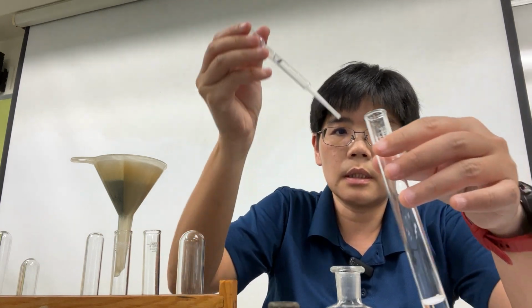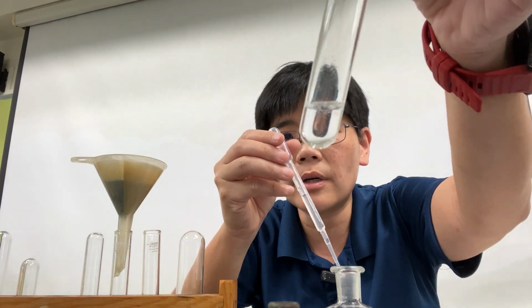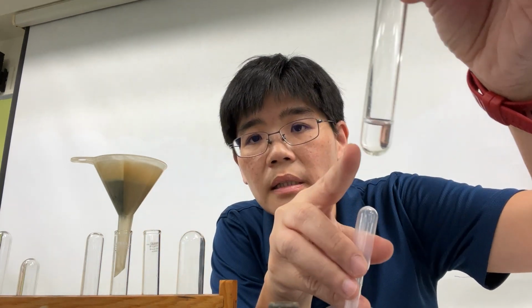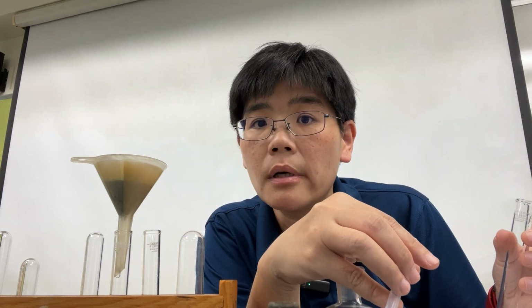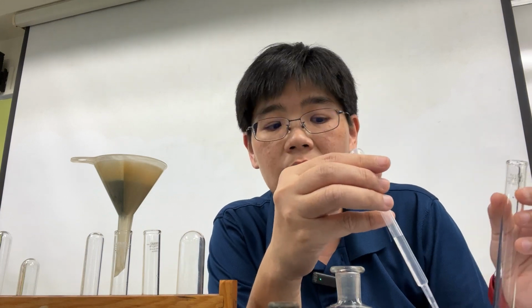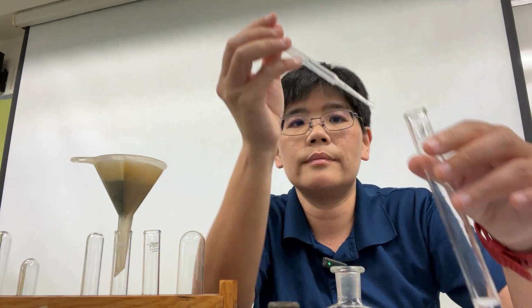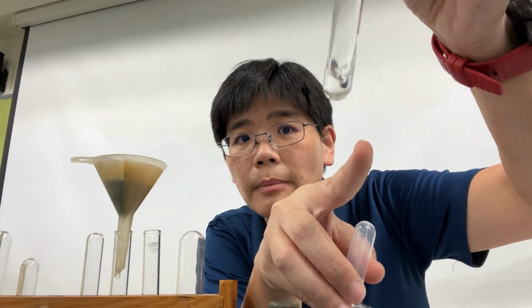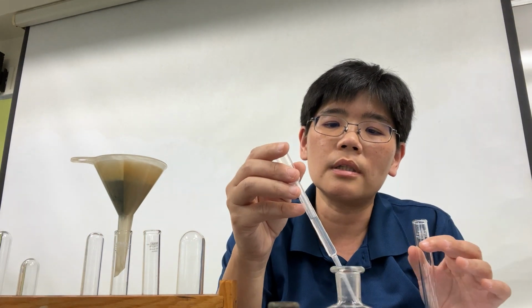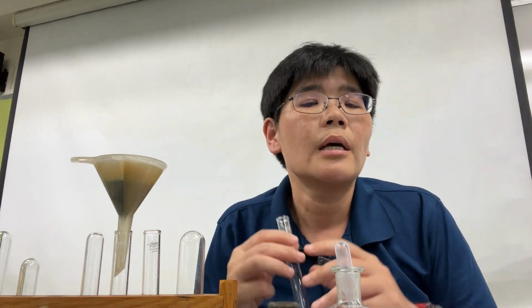So 1 centimeter. Oh. As soon as I add some of the sulfuric acid, I notice that there are bubbles or effervescence, and that I need to write down. So my observation is bubbles seen, or effervescence seen. I have not yet added fully the 1 centimeter, and the bubbles are already gone. So I will add a bit more of the acid because I need to generate more bubbles to test for the identity of this gas.